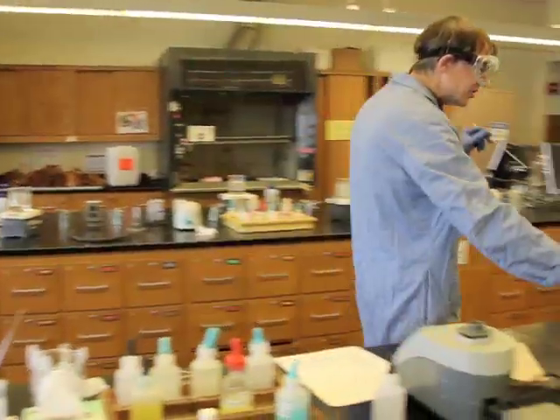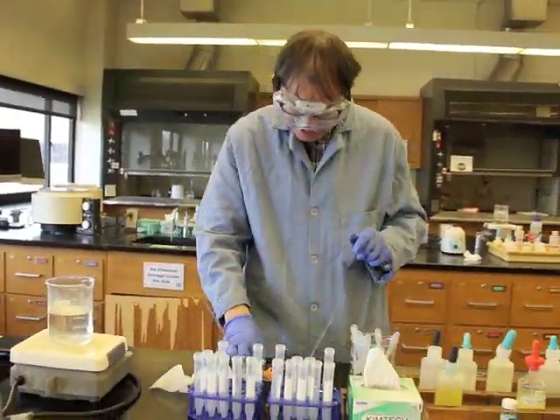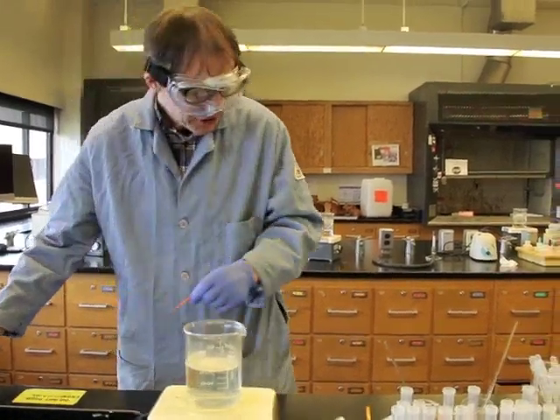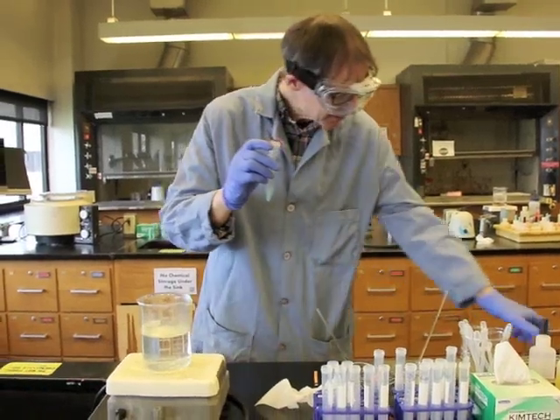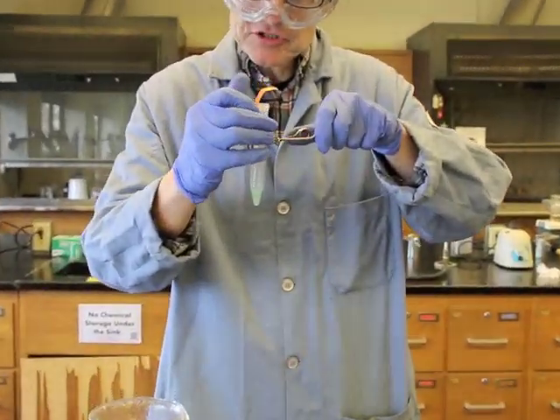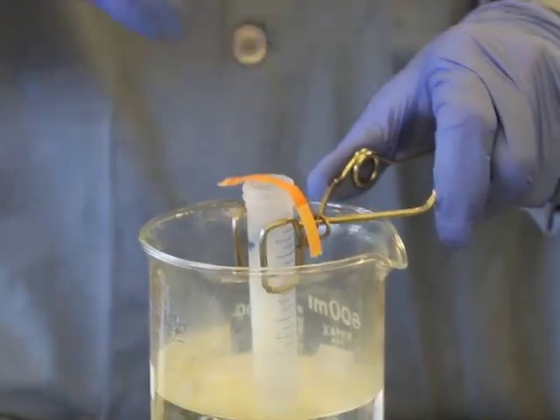So again, I'll come back over here, rinse this off, wipe it, and then put it back into there. We'll do exactly the same test. So the test says that we take some distilled water, wet this, put it over the lip, and then test to see whether we get the change of that dye that's embedded in the pH paper to see whether that turns green or not. If it turns green, that means there was ammonium in that solution. If it doesn't turn green, that means there wasn't ammonium.